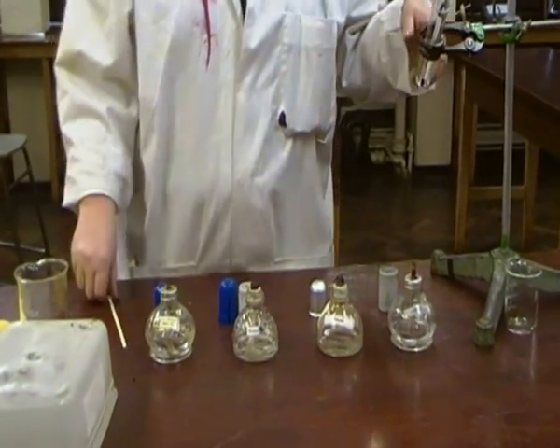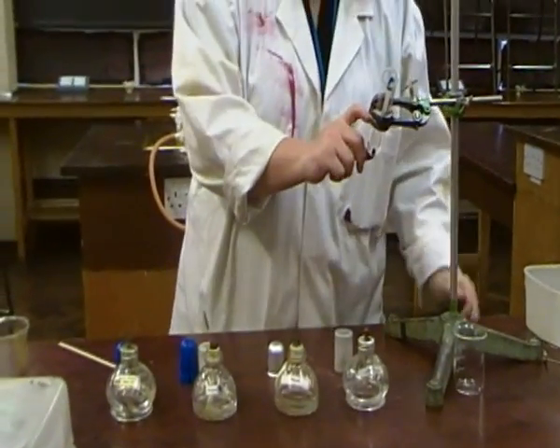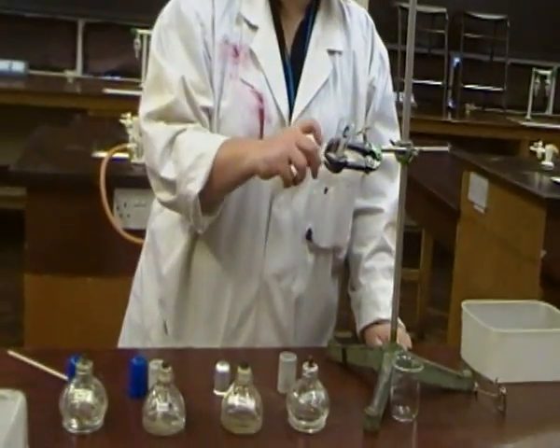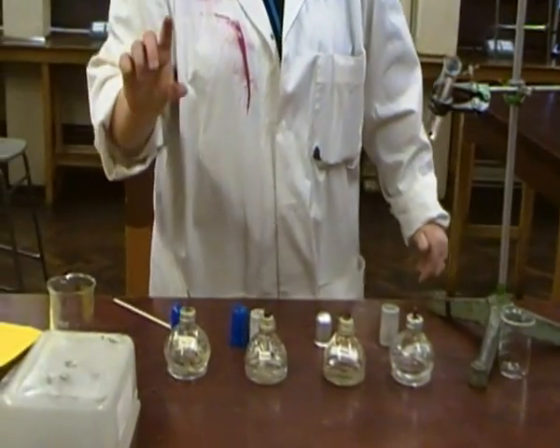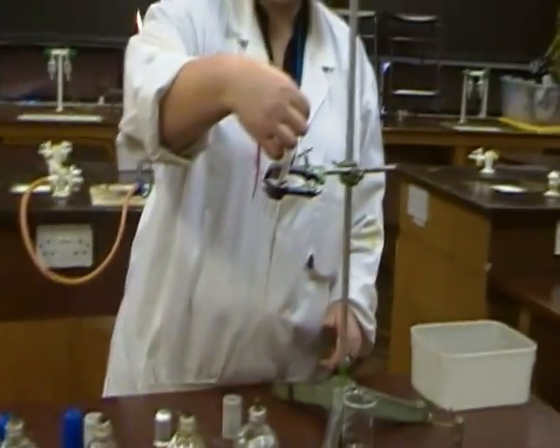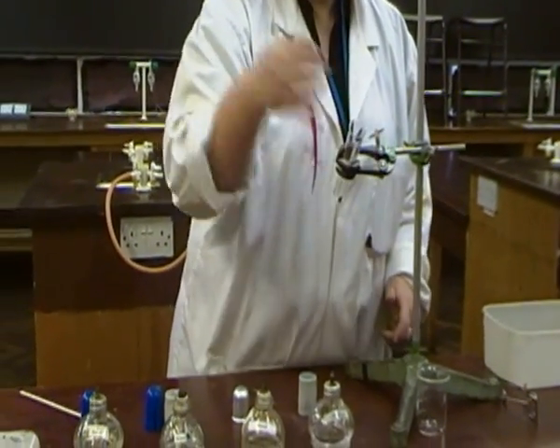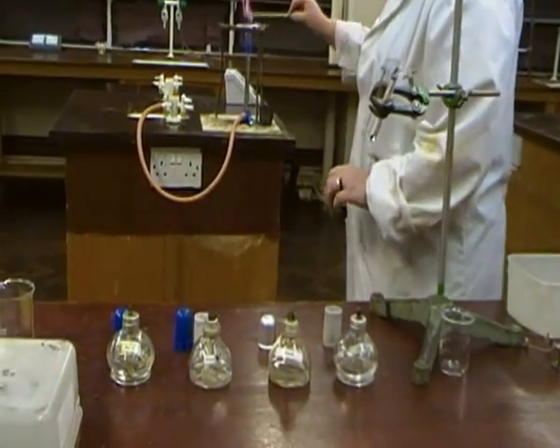Alright, so you would have a clamp stand, clamp, boss, test tube, fixed amount of water. Remember that's a controlled variable, fixing your amount of water each time. So I would have 25, 25, 25 and 25 centimeters cubed of water being heated. And a thermometer. I will measure my temperature first, note it down, and then heat again.